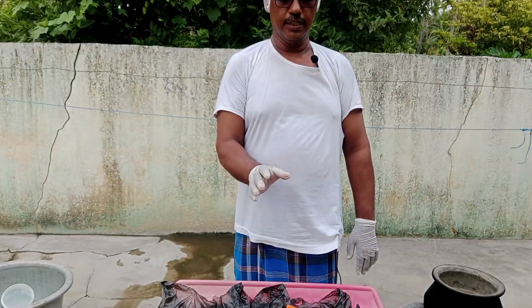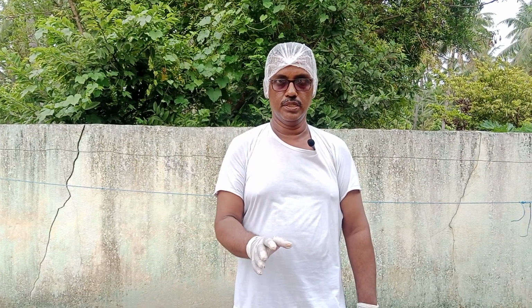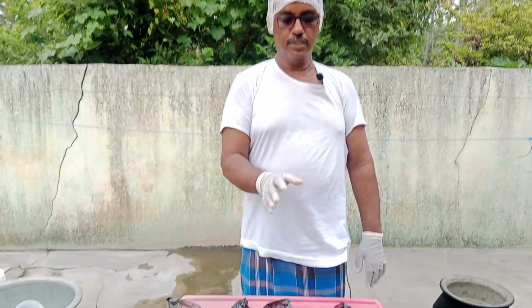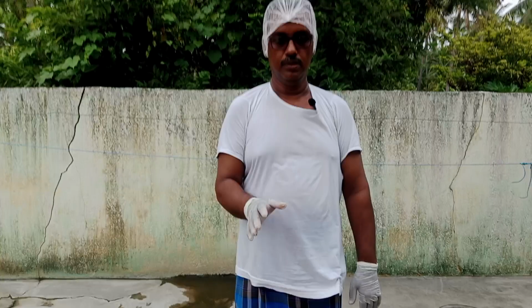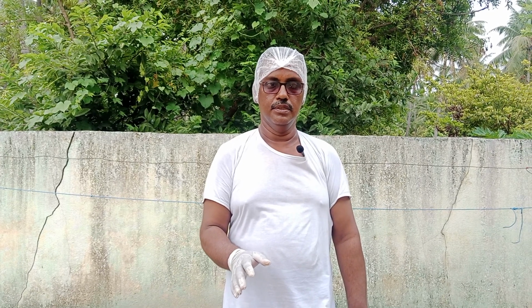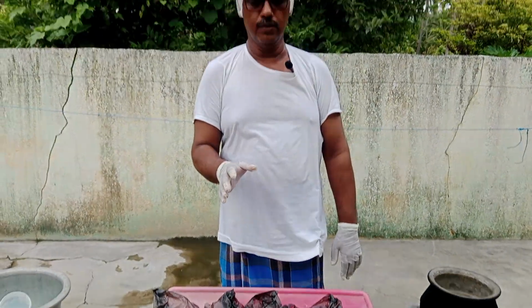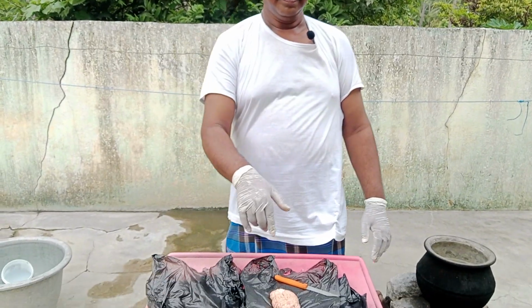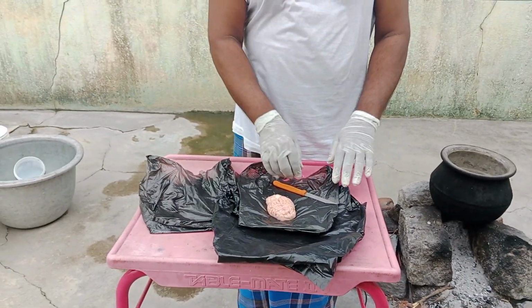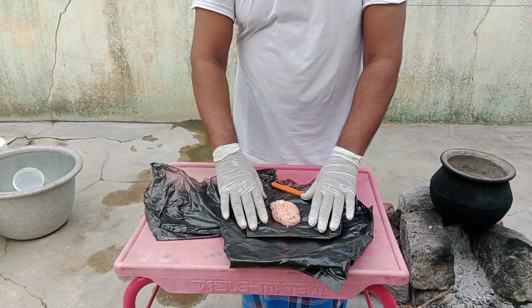This specimen is a real specimen which I procured from a butcher shop. Now the specimen which is going to be shown in this video is of a goat's brain. Understand, children? Shall we go into the video? See, this is the goat brain.